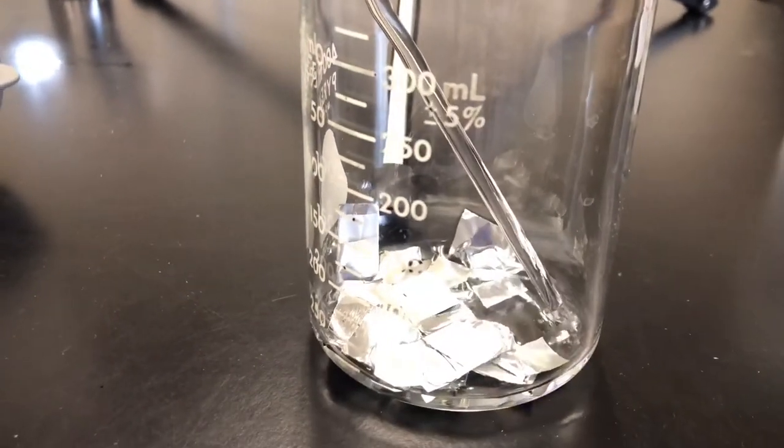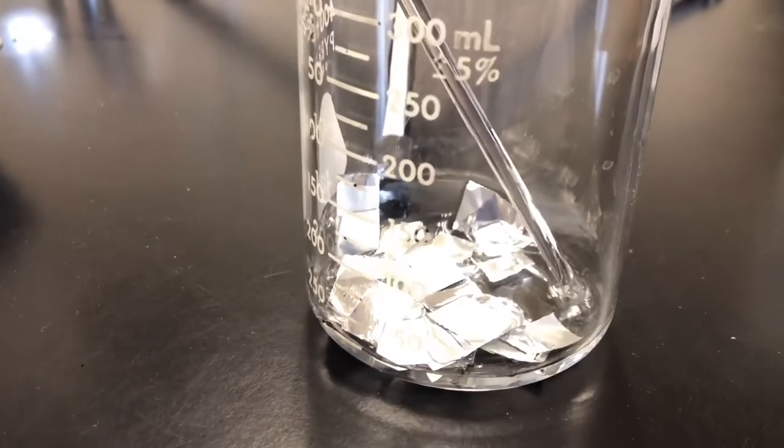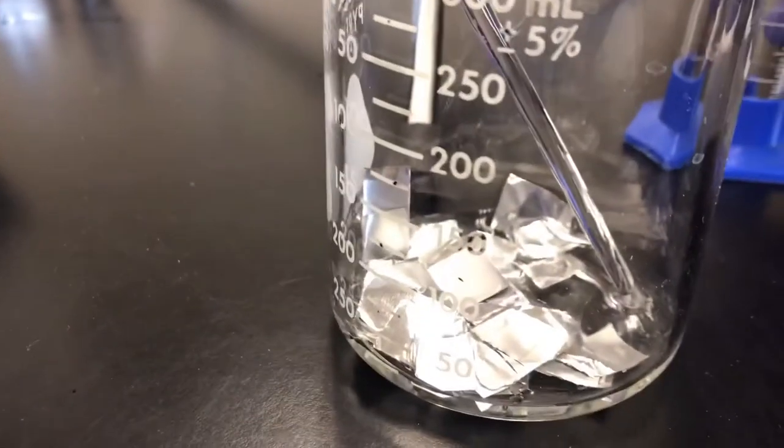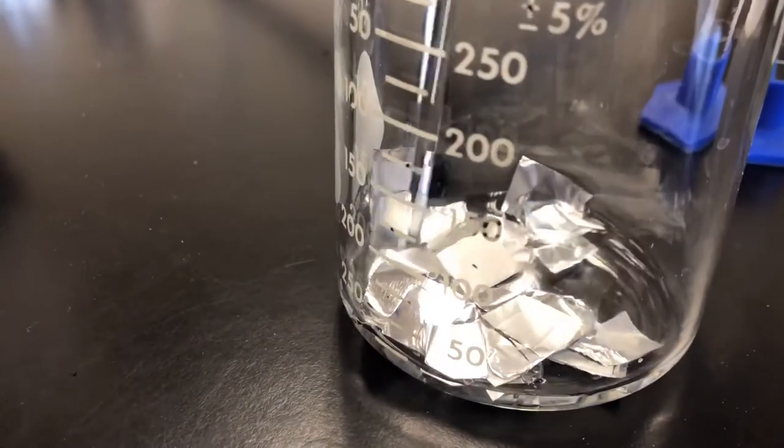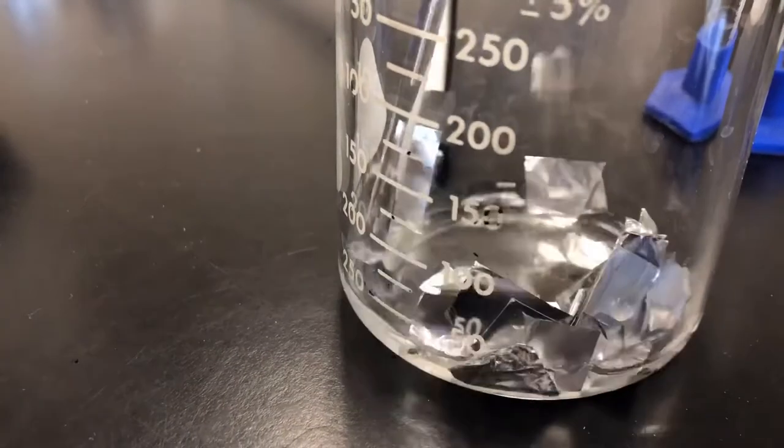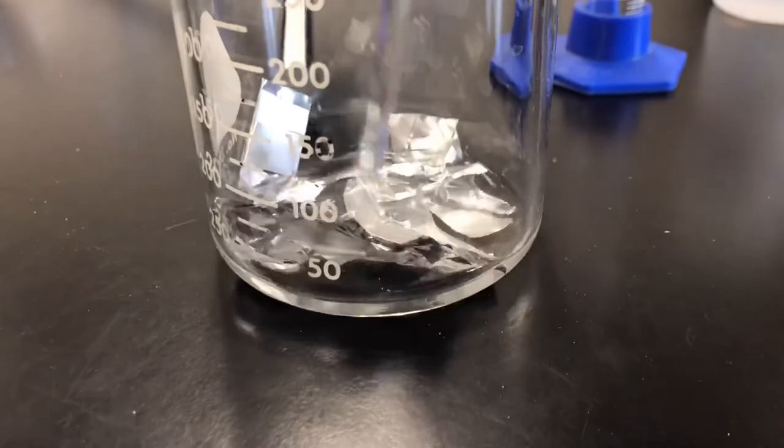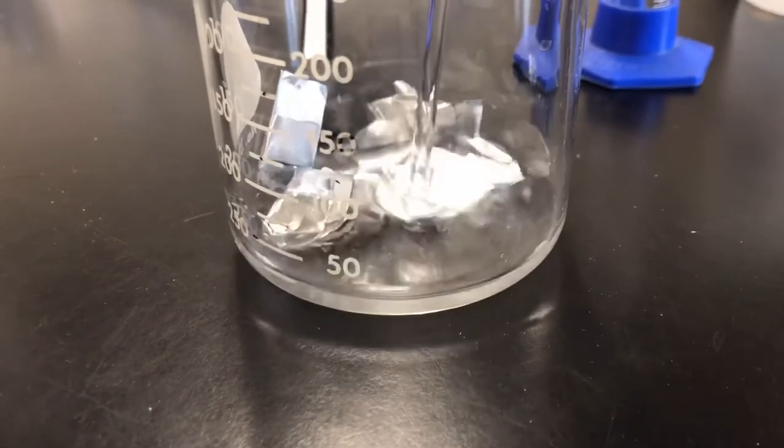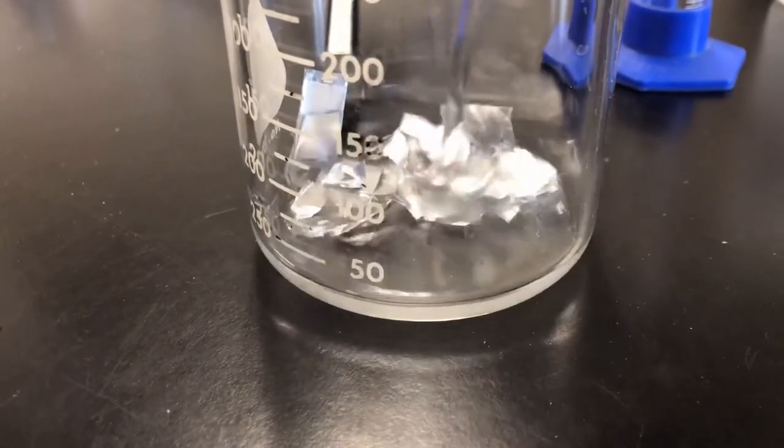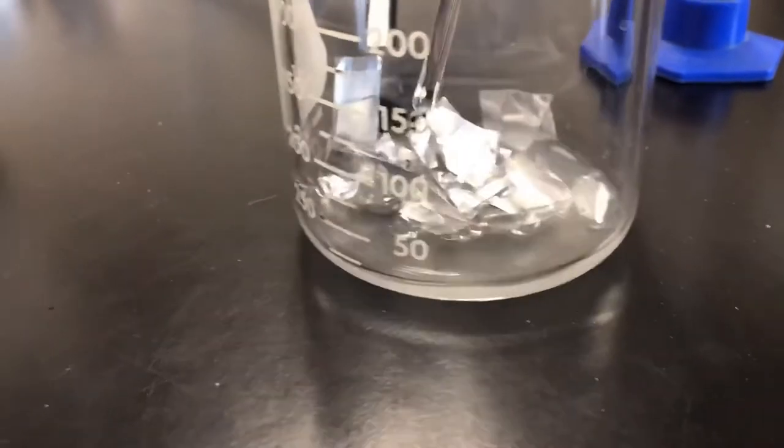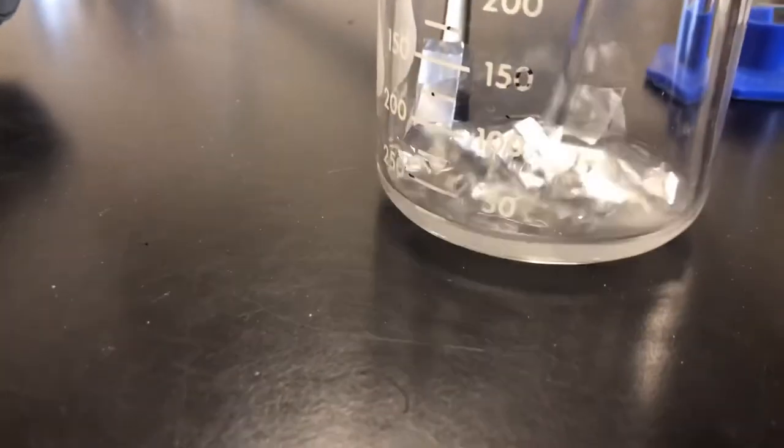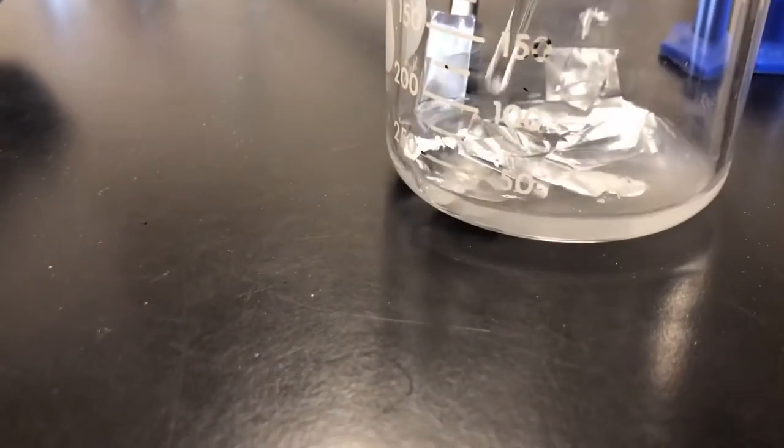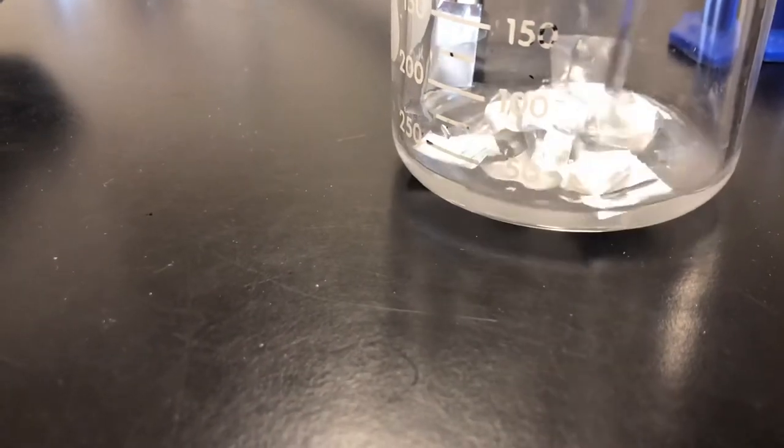And it's not going to start off super fast because the aluminum, we know, does have an aluminum oxide coating to it. You'll see it's starting to get cloudy.